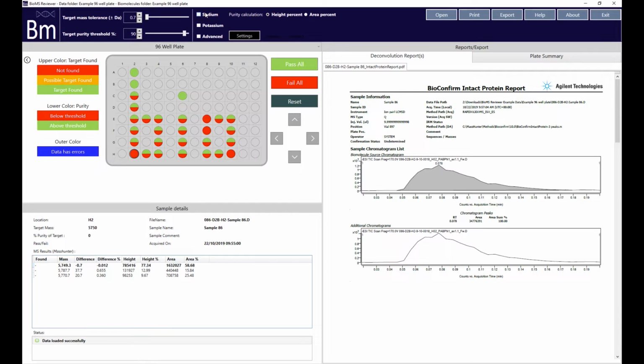Checking these adduct boxes will include ions 22 and 38 daltons higher than the target mass, corresponding to a single sodium or potassium adduct, in the purity calculations. If a target molecule can only be identified by means of one of these adduct ions, the upper half of the circle will be coloured amber.